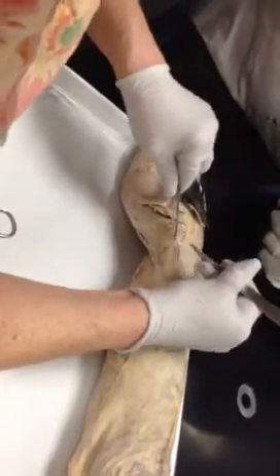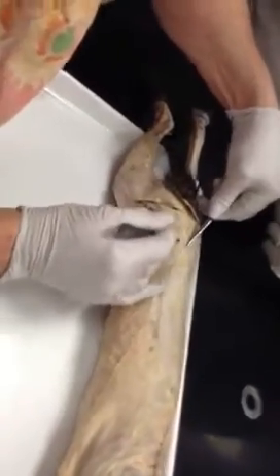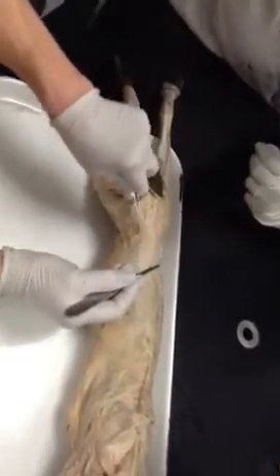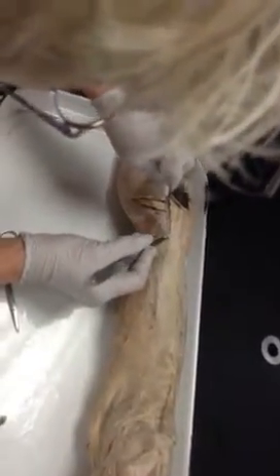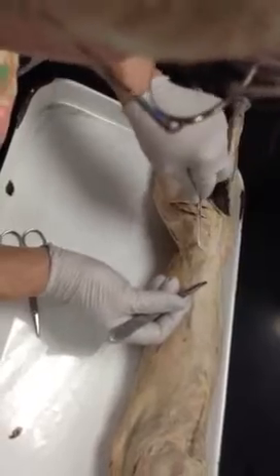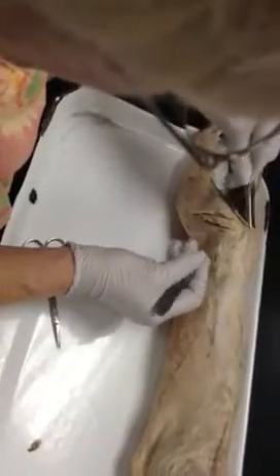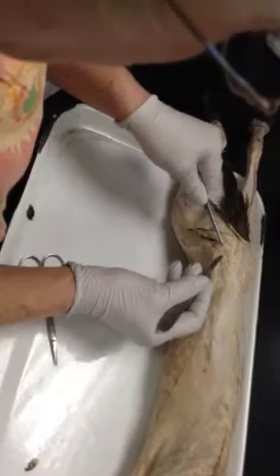Okay. Now, gluteus medius usually has a bunch of fascia on it, and it would be right below this. Okay, and this is the fascia. So, if I'm able to remove it, you'll be able to actually see the muscle fibers. The medius connects to the hip, right? Yep. Okay.